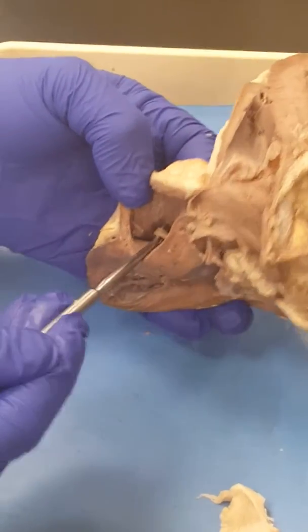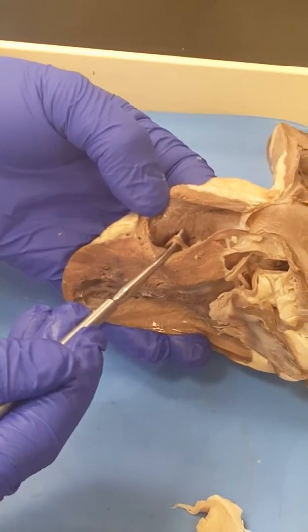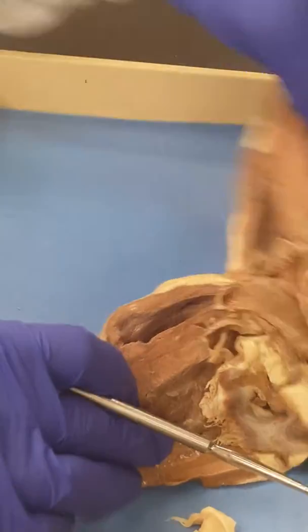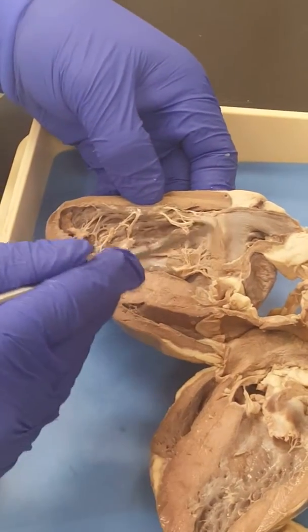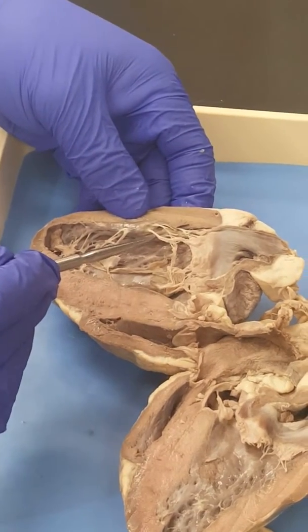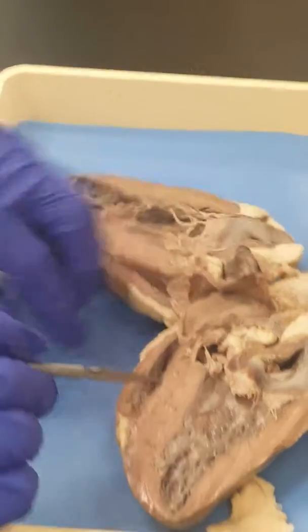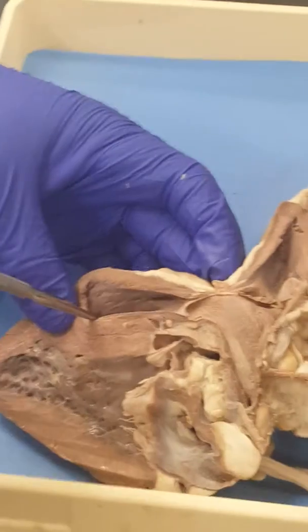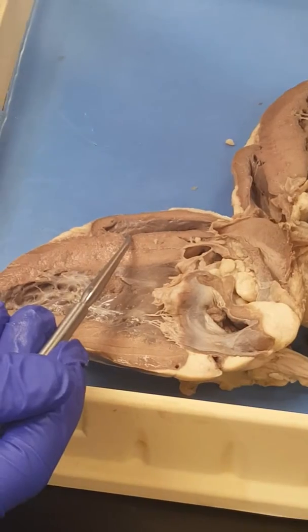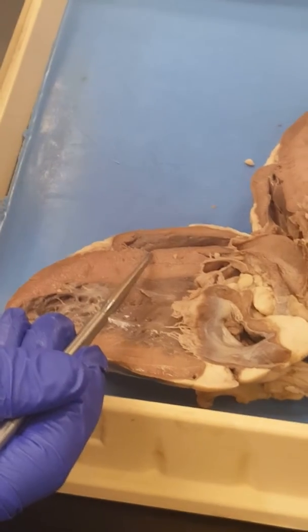And then also in the right side, you will see this. You see this other stringy-like structure, which is the moderator band. Do you see it? Can you see it in your video? Yes. Moderator band. Okay. The other stringy-like structures are these ones that are connected to the cusps, and this is the chordae tendineae. Chordae tendineae. So if I put a pin here and I'm saying what's that thin stringy-like structure, you say chordae tendineae. If I put a pin on here, inside here, and it goes through that, you say moderator band. Remember, it's one that moderates the filling of the right ventricle so that it doesn't pump with too much pressure going to the delicate lungs.